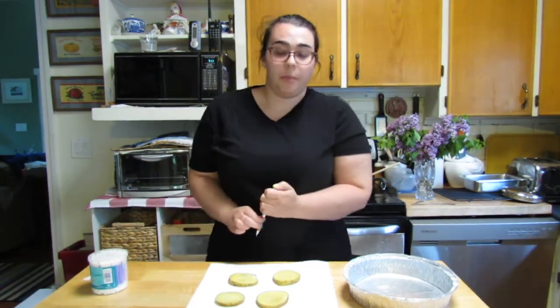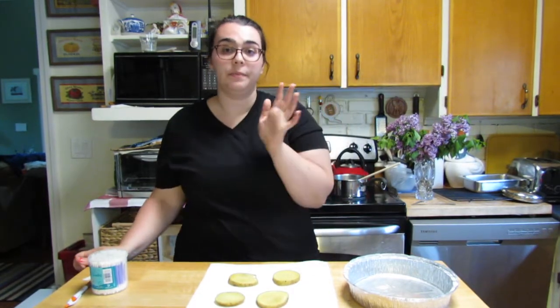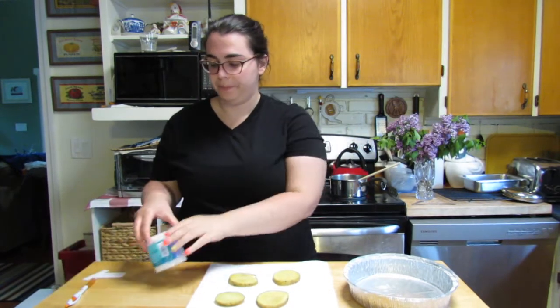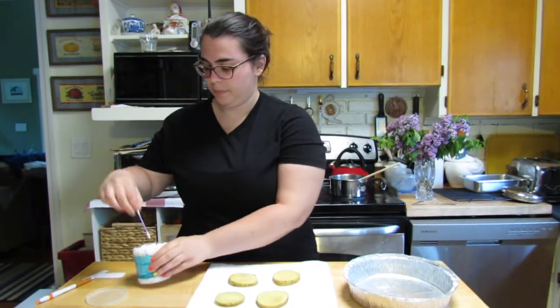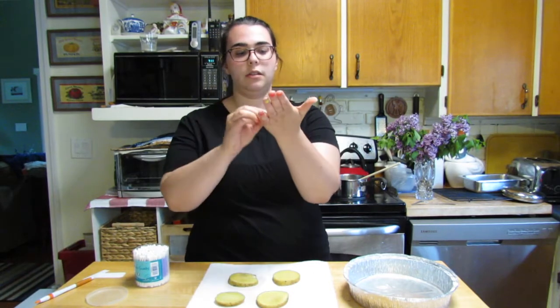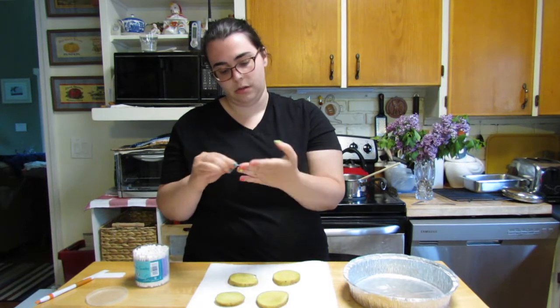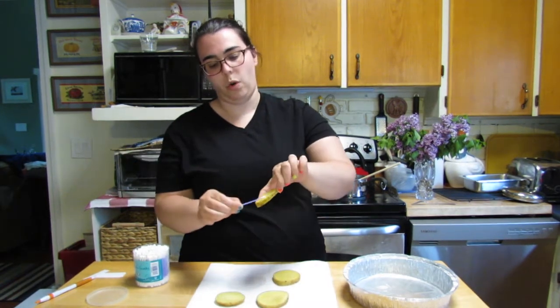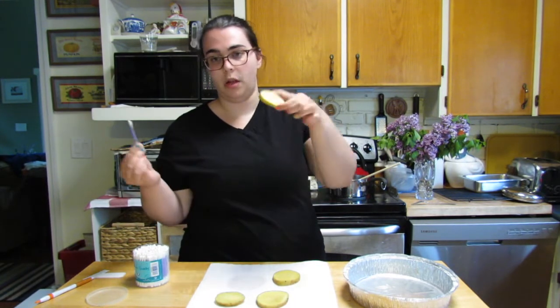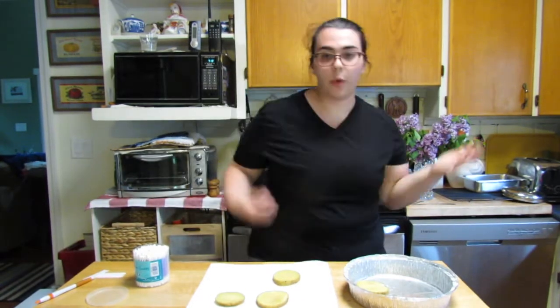Now I'm going to take some samples. A great place to get bacteria would be the surface of my hand — we're always telling each other to wash our hands, so let's see what grows on mine. I'll take a Q-tip, hold one end, and sample with the other end between my fingers. Then I'll hold the potato by the edges, wipe my sample on the potato, put it on the plate, and label that one 'hand.'